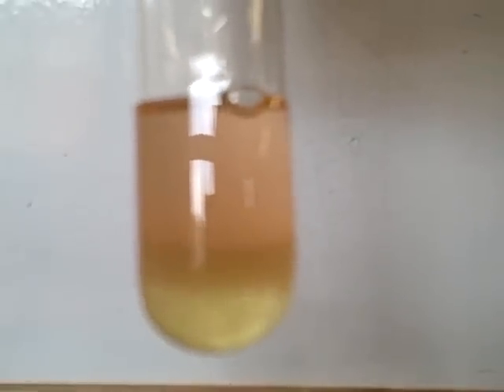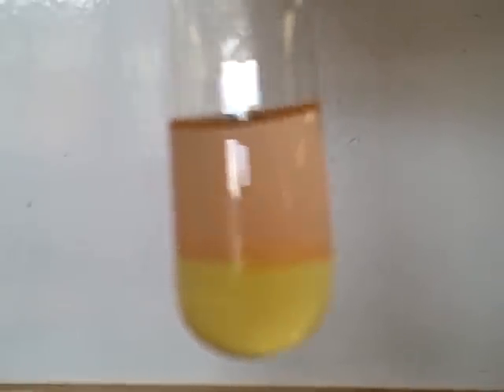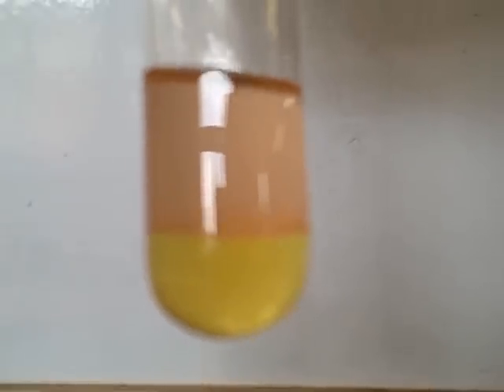Experiment three. I have a clear solution, and I'm going to add to that another clear solution. I'll give this one a shake and leave it for a second. My observation is that an orangey-reddish solution is formed there — orangey red.